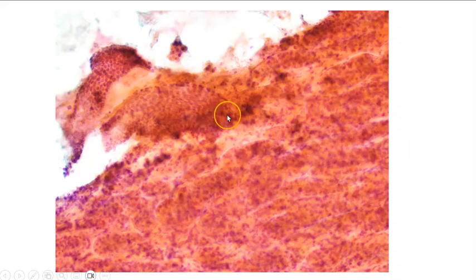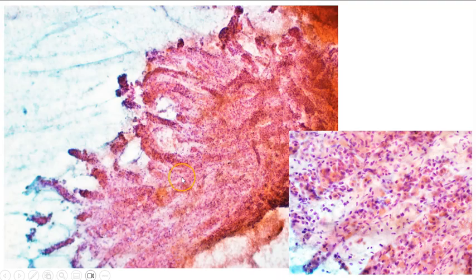This is an intact tissue fragment of gastric mucosa, so not only do we see the foveolar epithelium here, we can actually see the gastric glands with some lamina propria in between. And here is another example. We can actually see the columns that form the gastric glands and the lamina propria in between. This is a higher magnification picture. Here we are also able to pick out that there are some larger cells with orangophilic cytoplasm, and these are actually the parietal cells in gastric specialized mucosa.